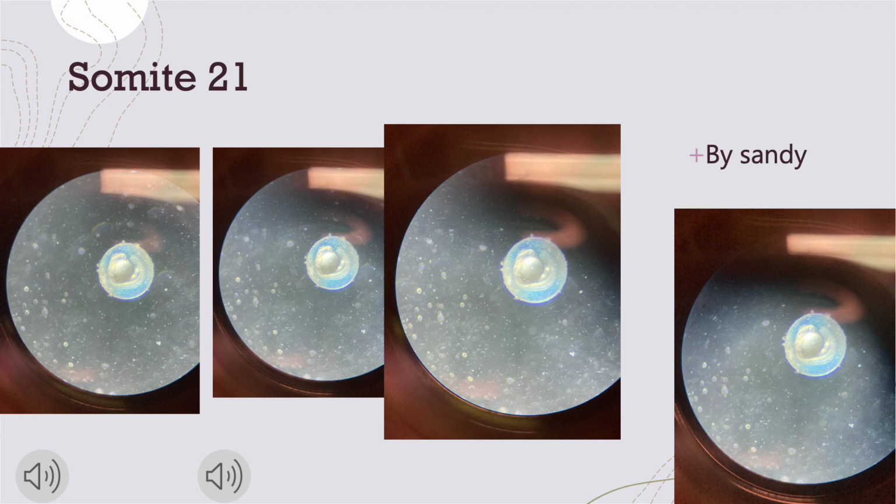At this point, the neural rod has become the neural tube, and you can also start to see some muscular contractions. Here you can see that this little guy is in the somite 21 stage. You can also see some of the more distinctive features of zebrafish. Here you can also see his constricted yolk and his elongated tail that's starting to peek out in the bottom.